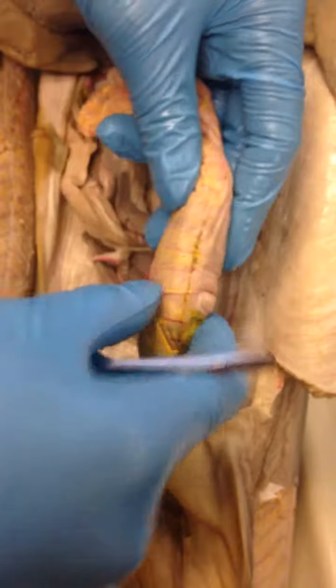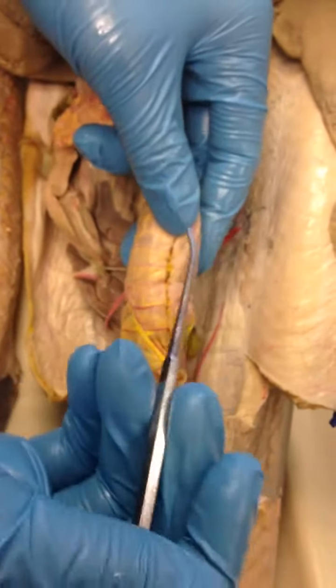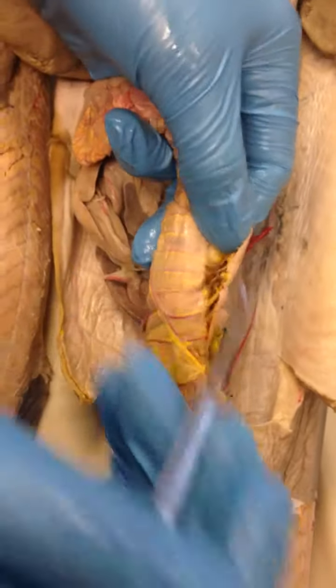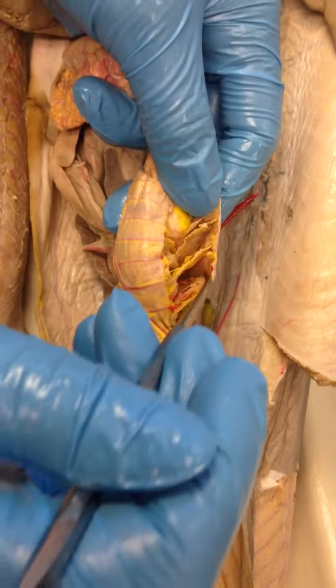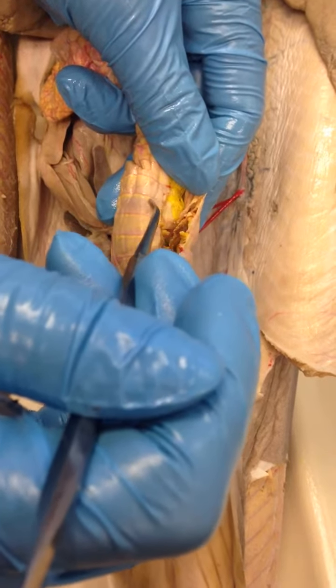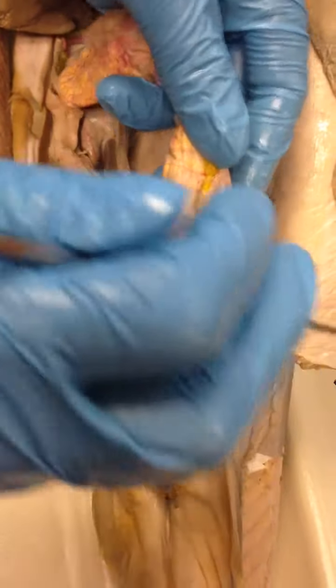Okay. The intra-intestinal arteries will be inside the intestine itself. So it's going to be intra, which is in the intestine. So it'll be these lines here. So if you ever see a probe pointing inwards, that is the intra-intestinal artery. Okay.